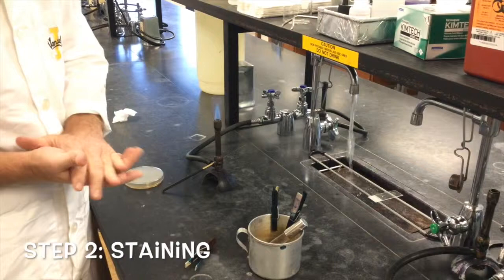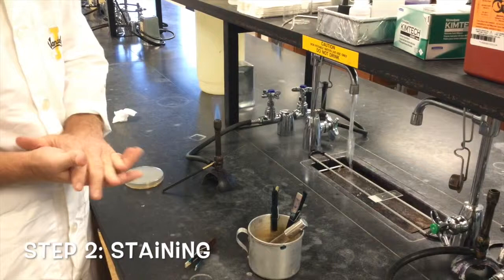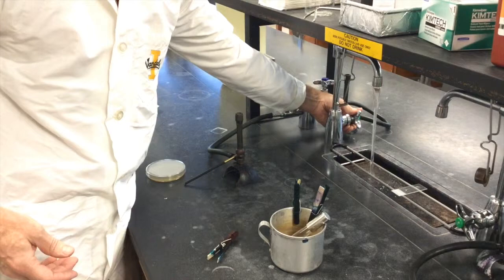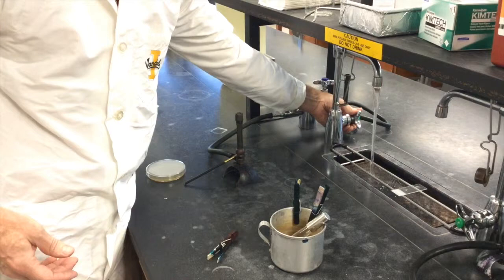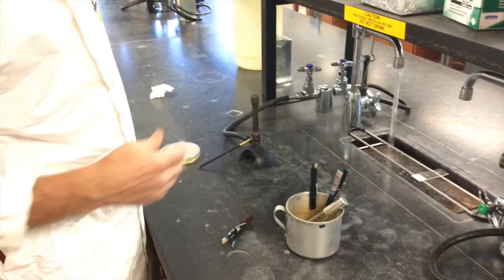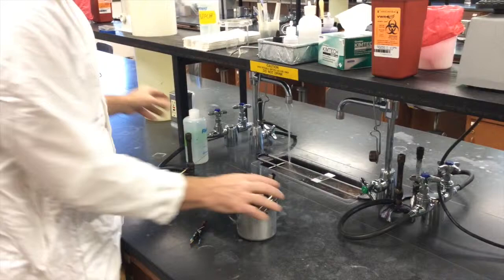Now you just place your slide onto a staining rack. This flame needs to be turned off before using any kind of stains because alcohol is involved in the staining process. So turn off your burner. I always have some water going here when I'm staining. But if there's too many slides on the staining rack, you can go ahead and use the squirt bottle of DI water as needed.